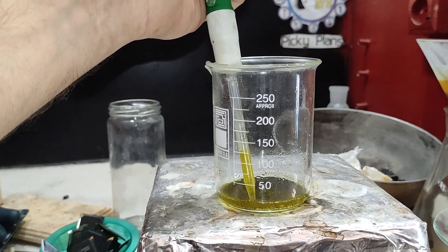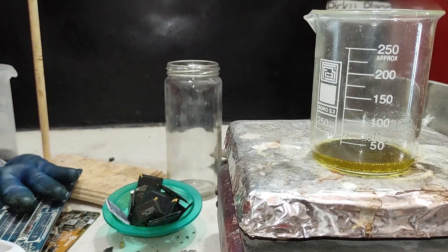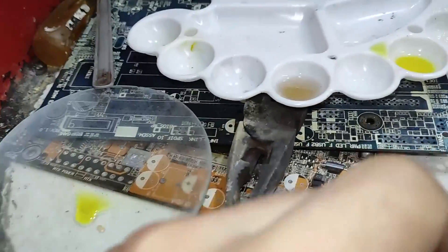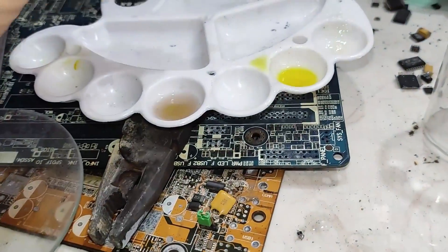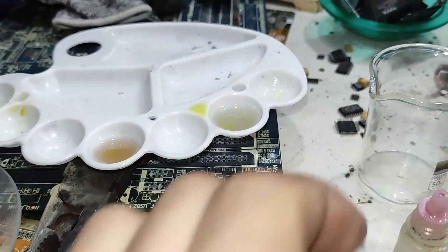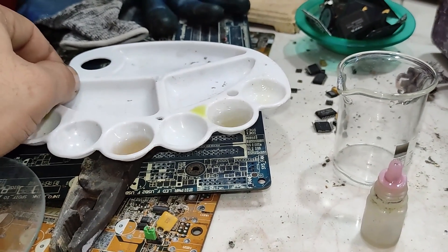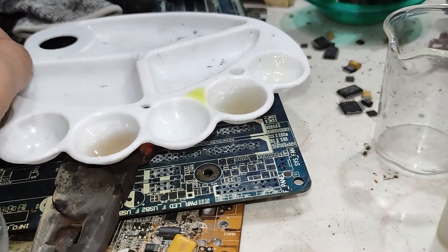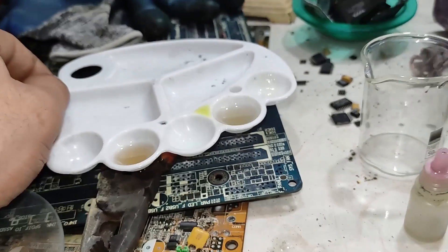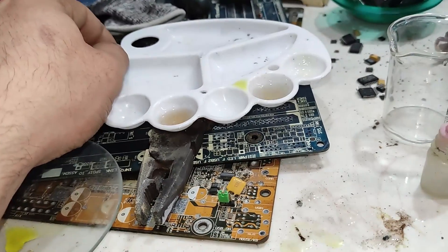Let's test it again after sitting for more minutes and further eliminating the nitric acid. And there we go — almost the same result from the second test of this solution. I hope you can see this color change, which hints at only a trace of gold in this sample, which is reasonable for chemical testing — not an ideal method at all, but I managed to do it.